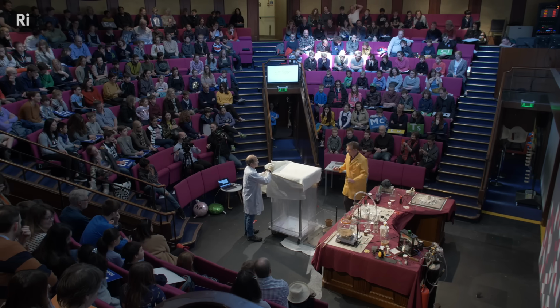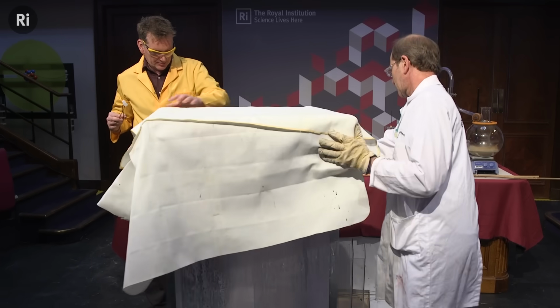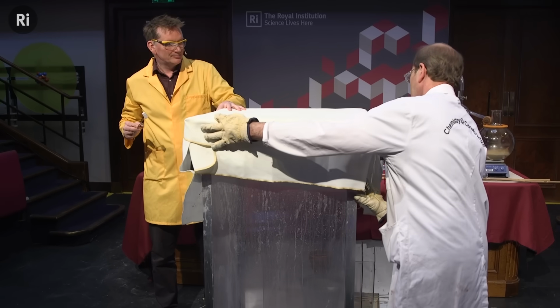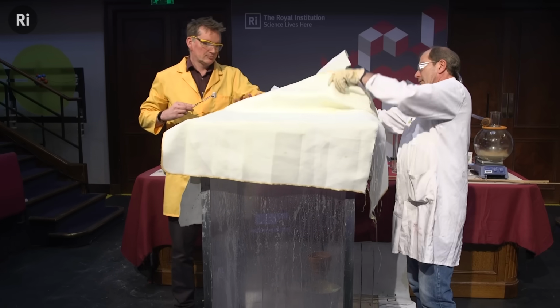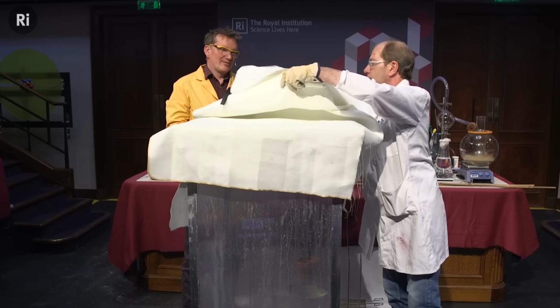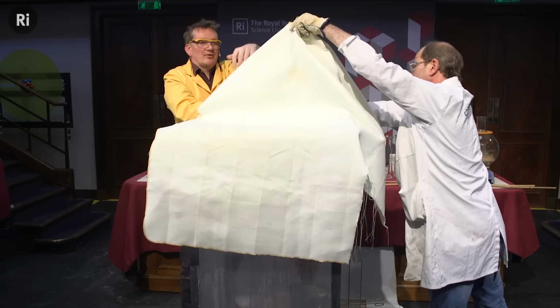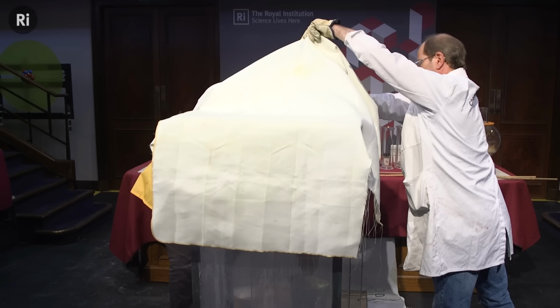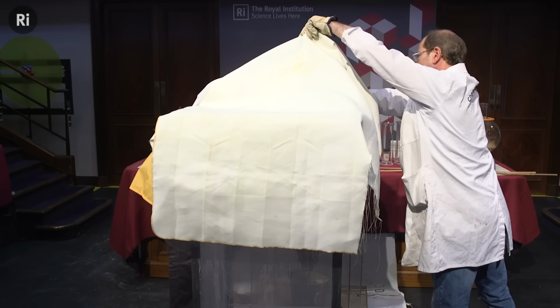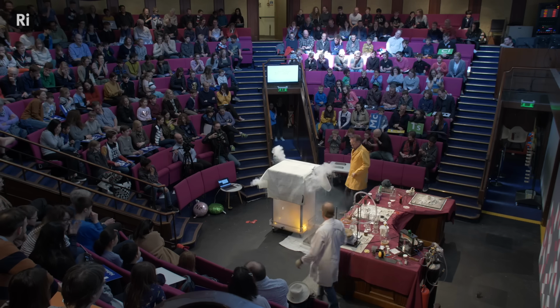Now, I need to be slightly careful when I'm adding this because, as I say, there are 3 different lids. Which way is it the right way around? Okay, and we're coming in this way, are we? All right. Always slightly nerve-wracking, this one. Okay. All right. Okay, we ready with this? So I need to make sure I get this. There are, as I say, 3 lids and 3 holes that I need to get this aligned. Okay, we ready? Oh. Oh. Okay, Chris.